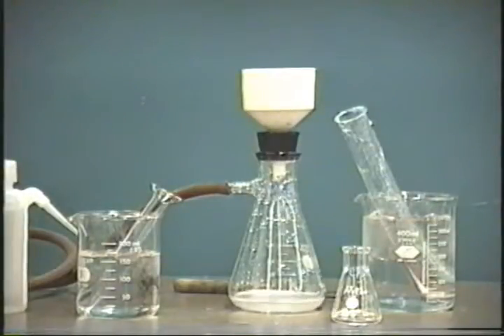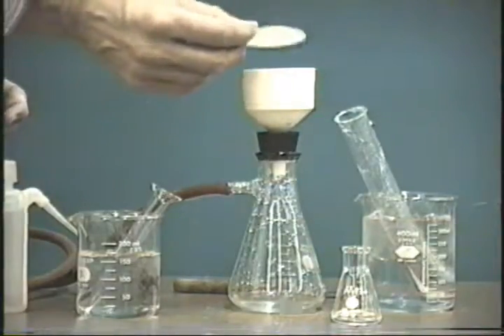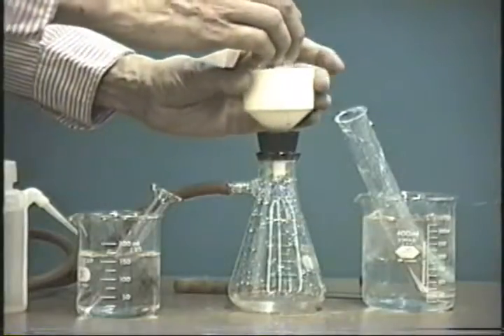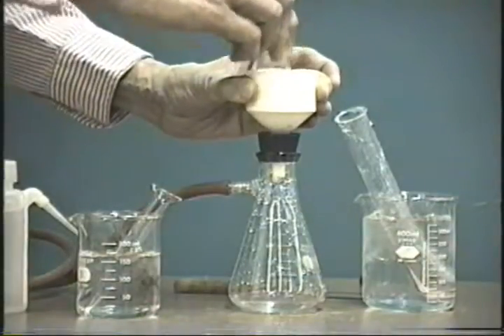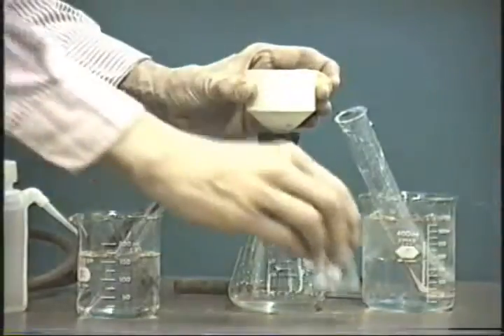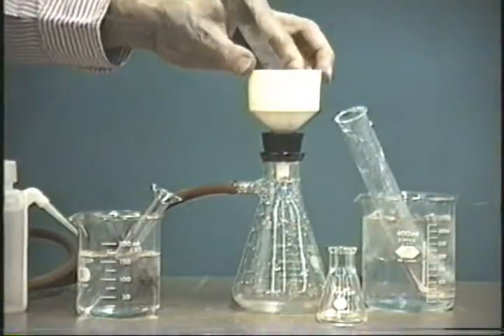And now we have put all of our sodium bicarbonate into the Buchner funnel. At this point, when it has sucked itself relatively dry, we'll take a clean, dry piece of filter paper and put it right on top. With a small Erlenmeyer flask or a rubber stopper, we will press this down. This way we will press down any additional water which may still be in the filter cake here. Then we will take out this piece of filter paper.